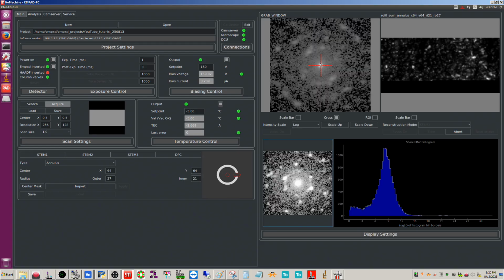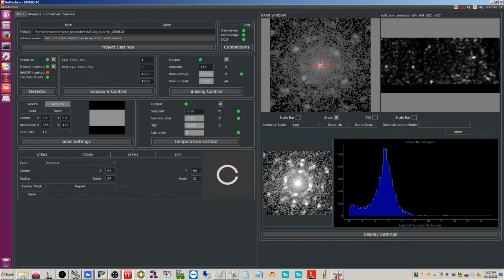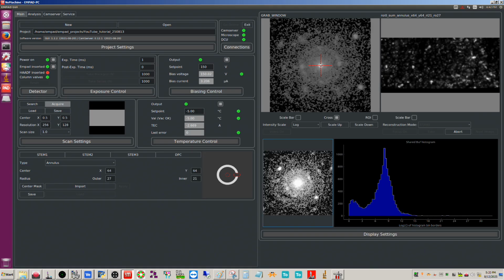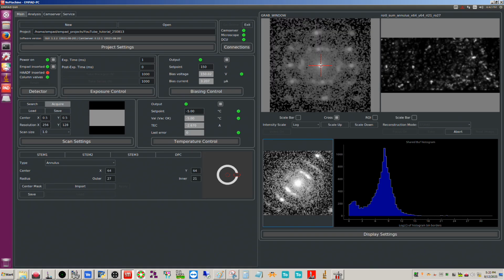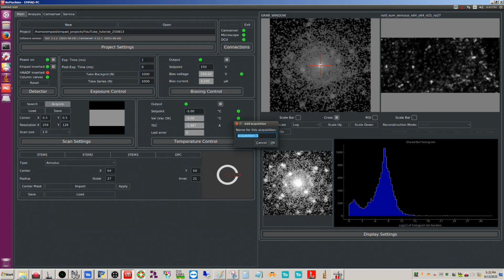One thing I don't like about this is there's no drift correction, though. So this is unfortunate. At this scale, probably not an issue, but you can kind of imagine at higher magnification, this could potentially be a problem. But there's no way to drift correct here.